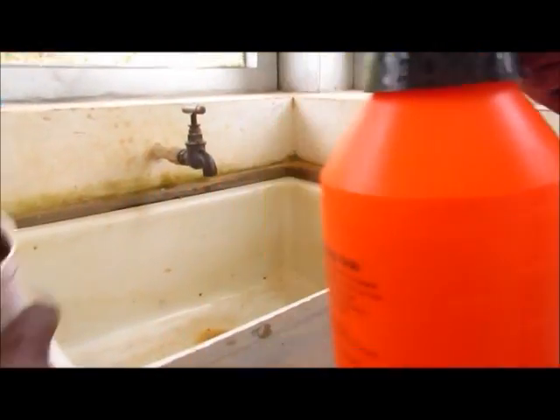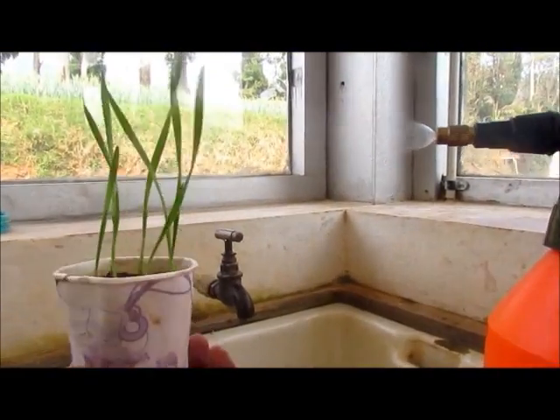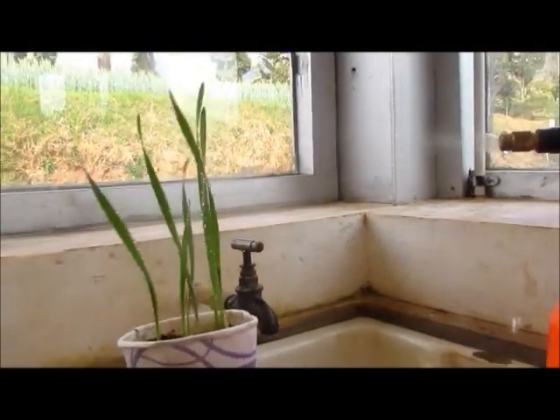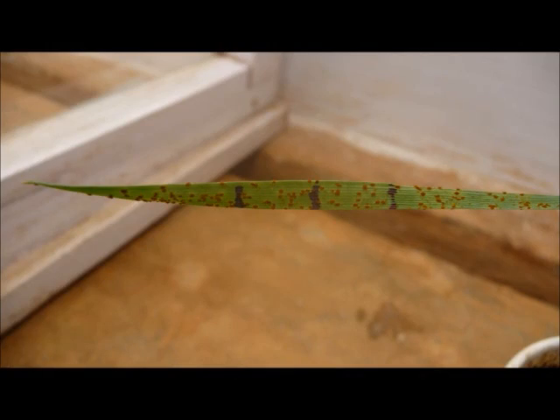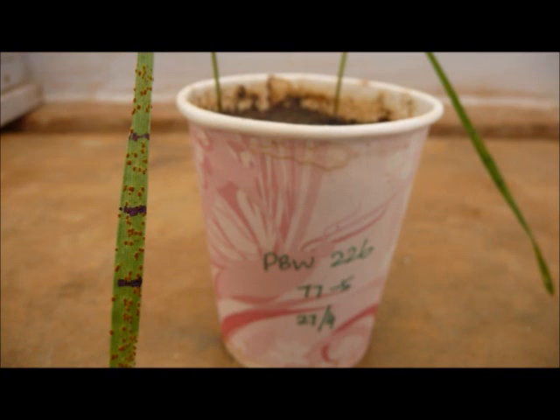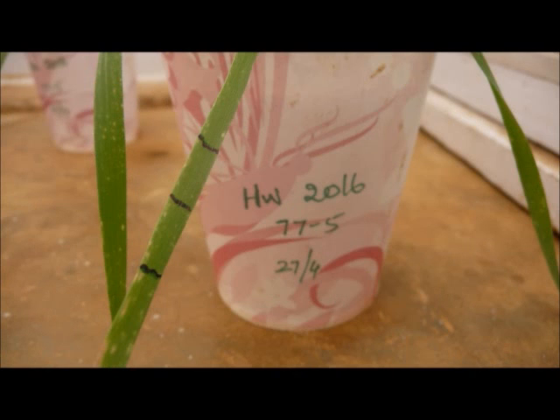After inoculation of the spores, spray water on the seedlings to keep moisture at a high level. Then place the inoculated seedlings inside a glass chamber. After pathogen inoculation, the seedlings start developing the rust infection. The infected leaf samples are then collected at different intervals of time.